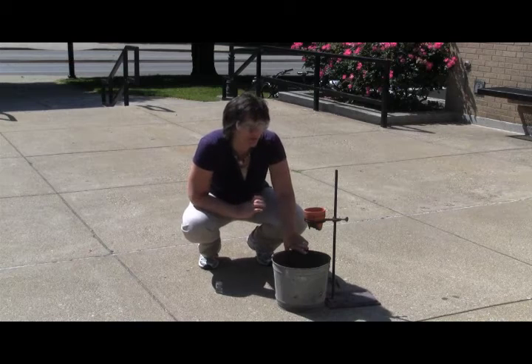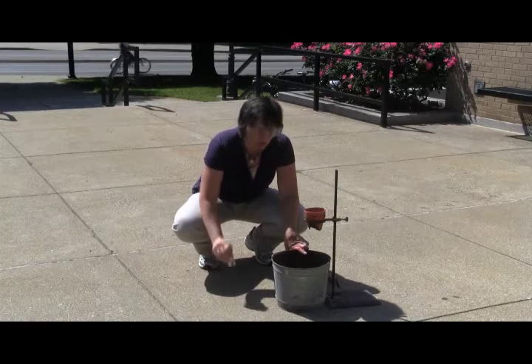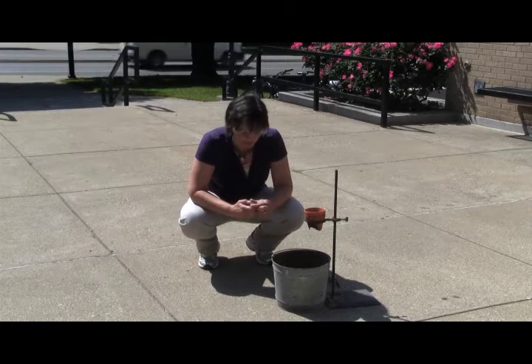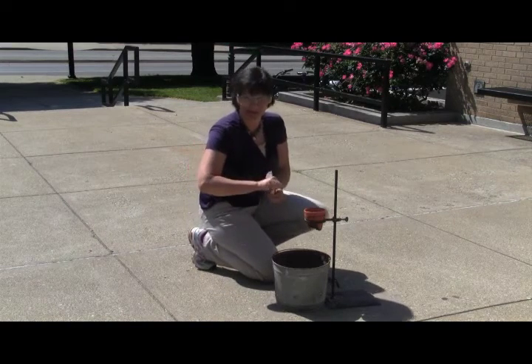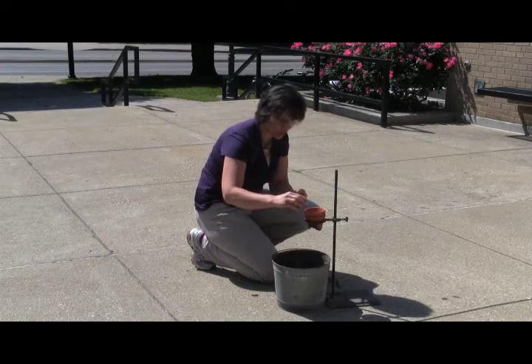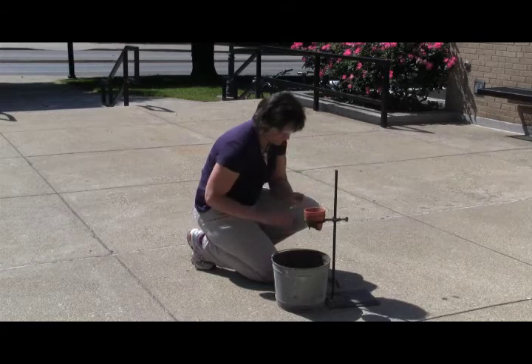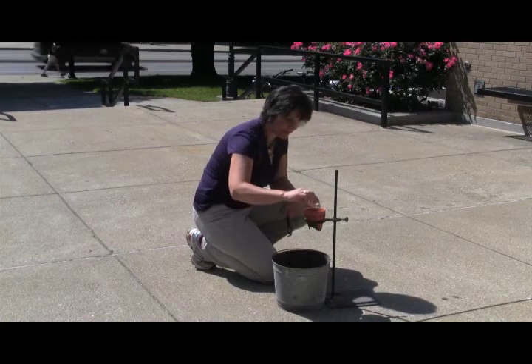But I don't want to be close to it when it happens, so I've got a fuse, an igniter, something to get it started, and that's these two ingredients. So this is just a little side reaction to give it enough heat to light it, kind of like you light a Bunsen burner with a match. Well, this I'm going to light with just a delay mechanism, okay? You're going to know that the reaction is taking place because before it happens, it starts smoking and sizzling, and then it'll ignite. Okay, so this is a little potassium permanganate, and this is a little glycerol that I'm going to pour on top. That's going to give me my delay.